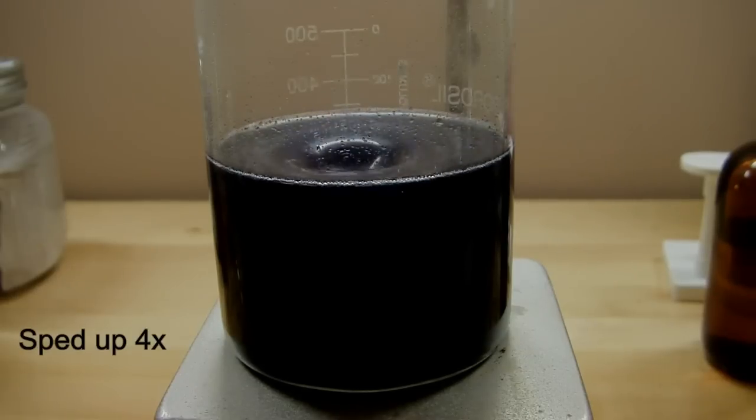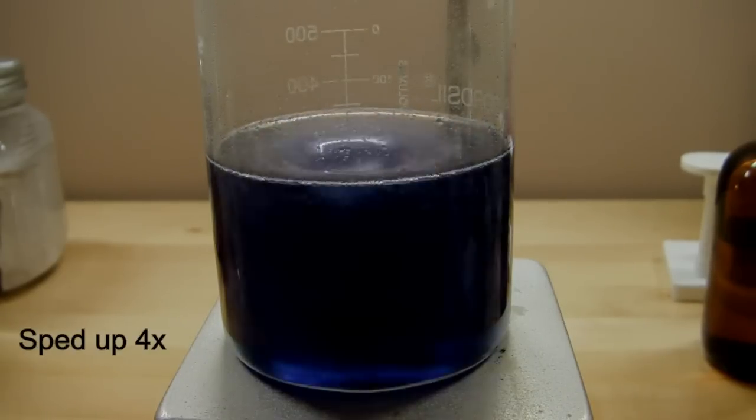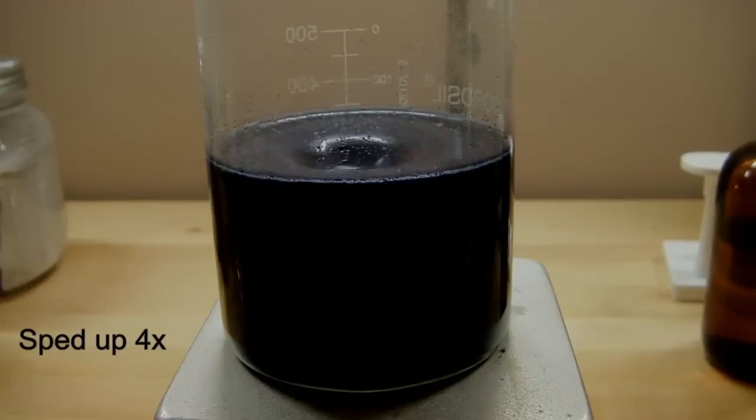I used 100 mL of each of the three solutions and this oscillated for almost 10 minutes. I sped up this part of the footage so you wouldn't have to sit through the whole thing. You can probably see the reaction slows down as it proceeds and it's finished when it remains at this blue stage.